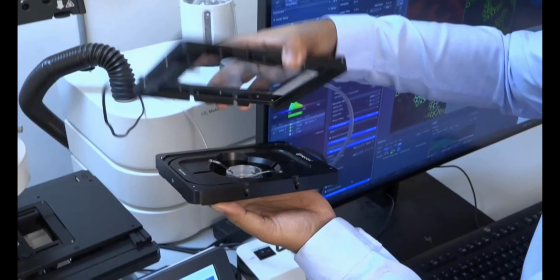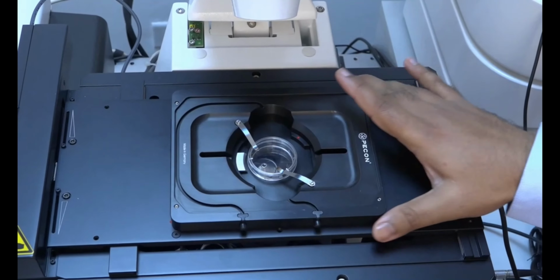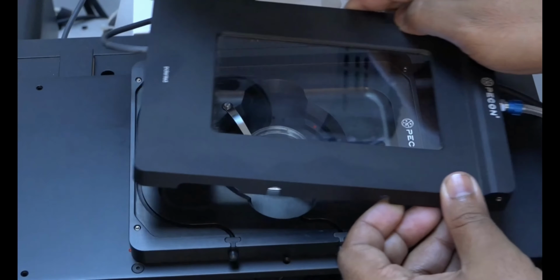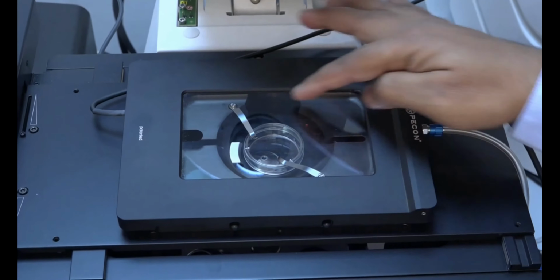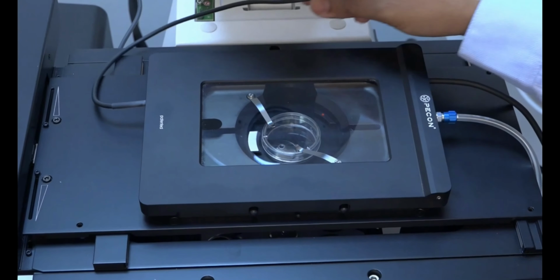This cover goes, and as you can see here, it sits onto this notch, and this entire attachment can sit. You can see this sits on top of it, and then you have to place the lid which is covering, and this will go in the groove. So the entire sample along with this entire chamber is closed. Now we can have the condenser pillar down, with the condenser up, so that the condenser doesn't touch the top of the glass.